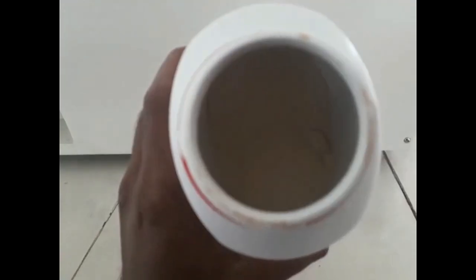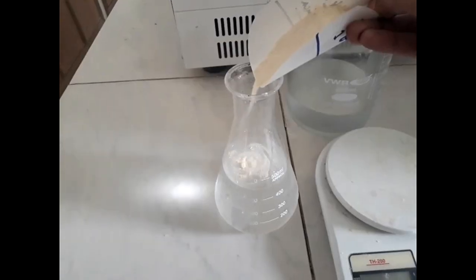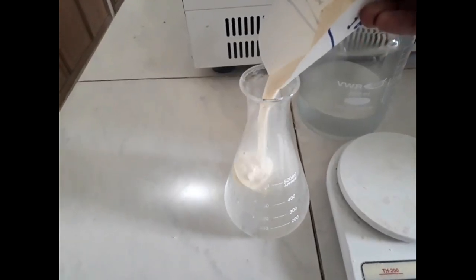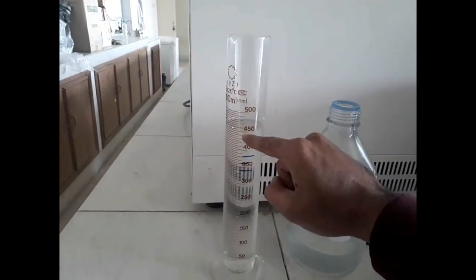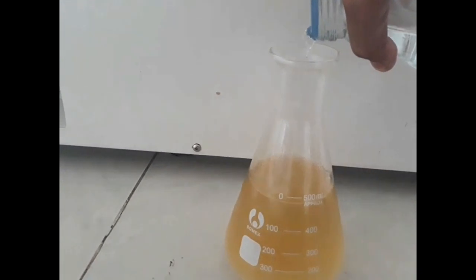So after adding this powder PDA into the 450 ml of distilled water, at last we can easily manage the required level of 500 ml mark, which is our required value for this PDA.